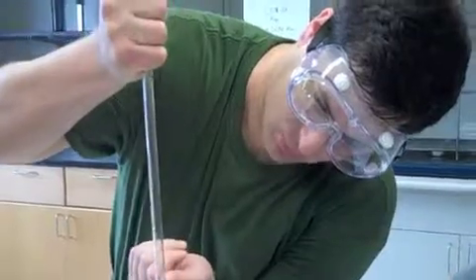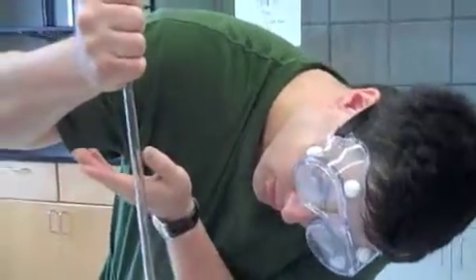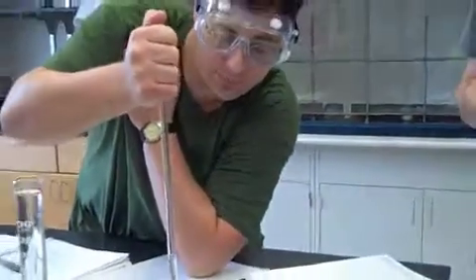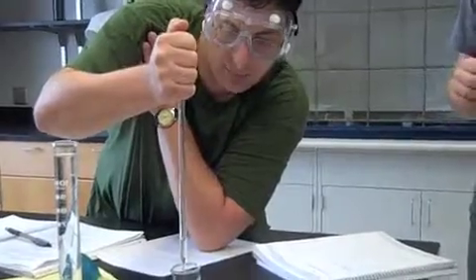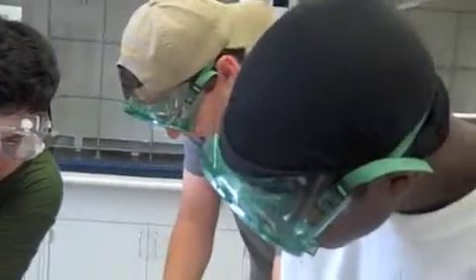And that's a half, that's 1, it's about 1.4, I'm going to estimate 1.44 is my volume. And so, will somebody record that volume for 1.44 please? Milliliters.